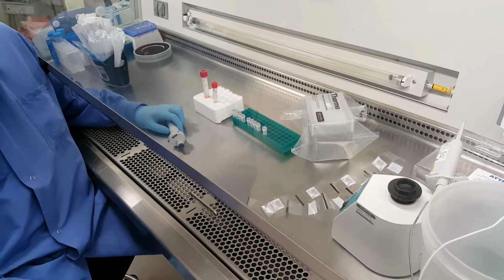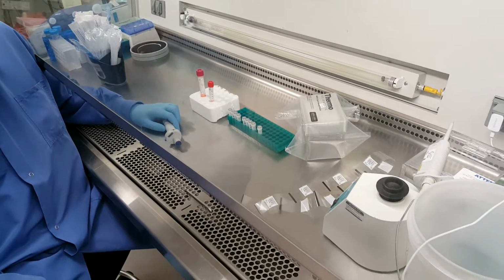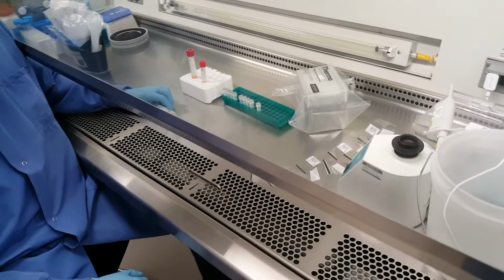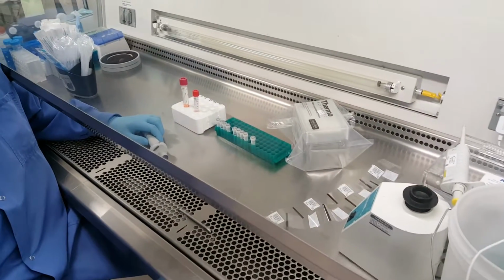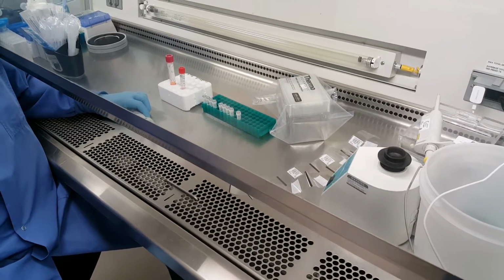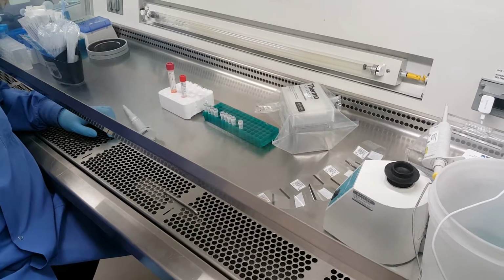All right, this is take 3 on the virology aliquoting. At this point, we are beginning it. We do expect the aliquoting to be done under a hood. And to begin with, make sure that you have the required materials under the hood with you.